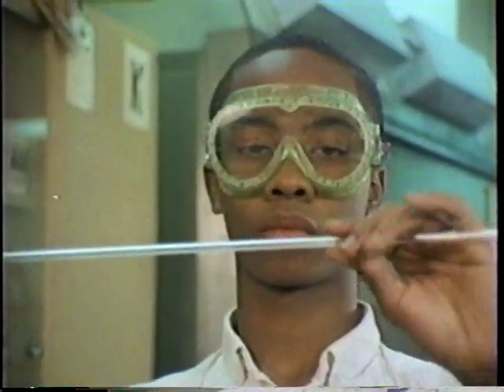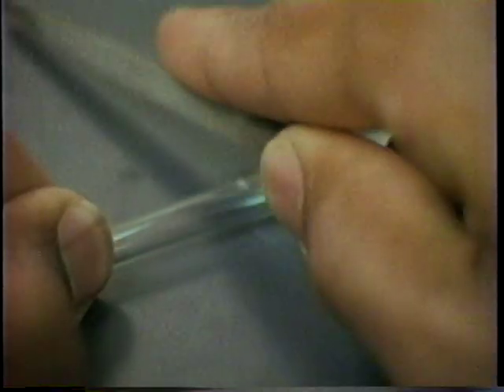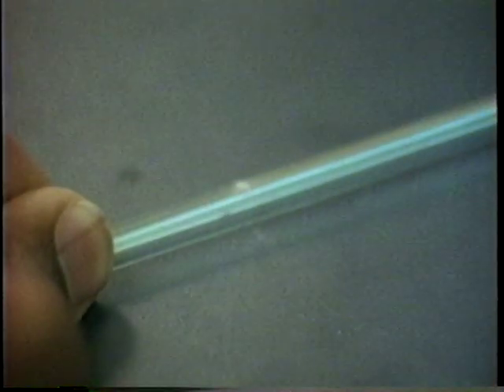Okay. So what happened next? Well, let's see. I had to bend some glass tubing for an experiment I was doing. First, I cut the tubing to the right length. I did this by making a deep scratch in the glass with a file.